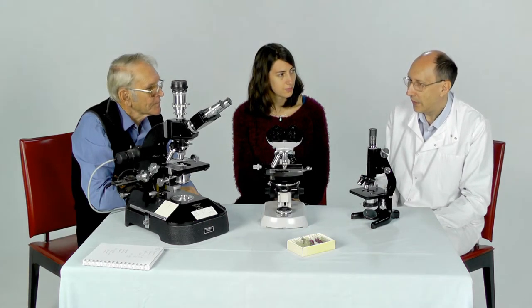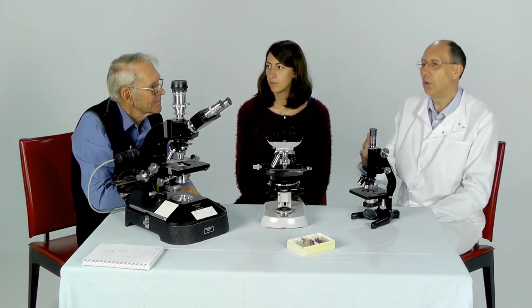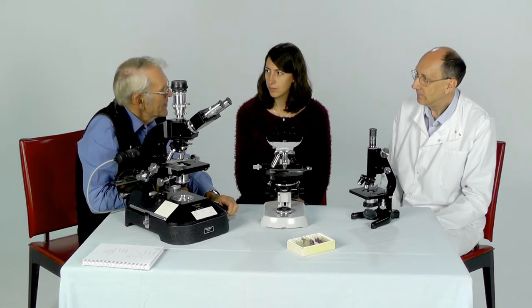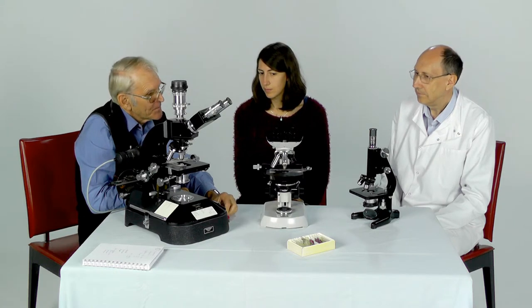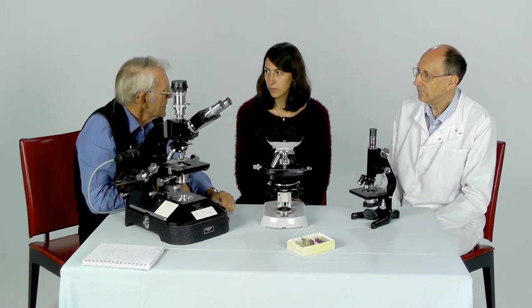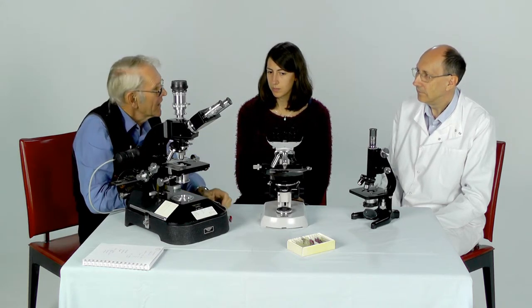The lens system that is always underrated is the condenser. Why is that important from an optical point of view in microscopy? It's like a chain — the weakest link determines the ultimate quality you're going to get. You can get away with a fairly basic condenser arrangement, particularly with low power objectives, but really if you're looking for optimum results you need a more highly corrected condenser.